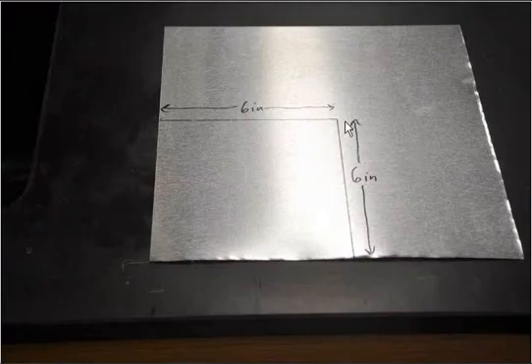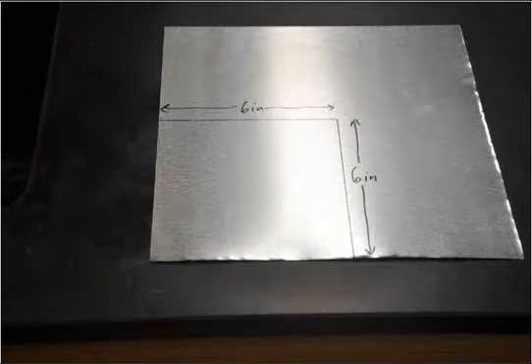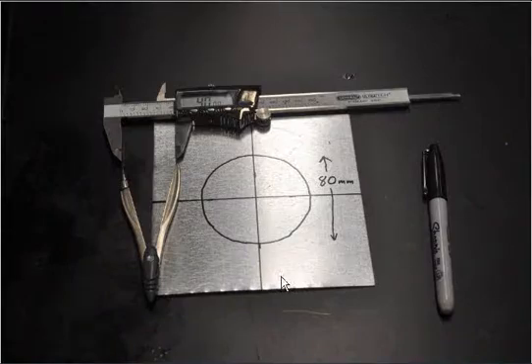We're going to draw out our six-inch squares. I just drew in the numbers so that you can see them on the video. We're going to cut out our six-inch square, just using tin snips. It cuts quite easily. Make sure you wear gloves, because the metal will cut you if you don't. And then mark the center point of the square itself.